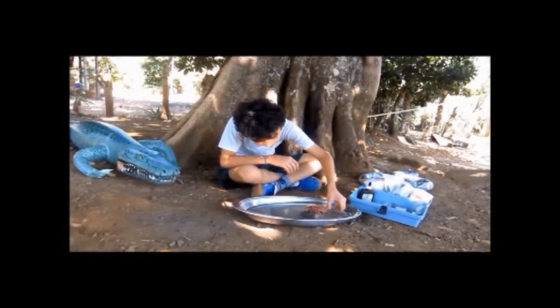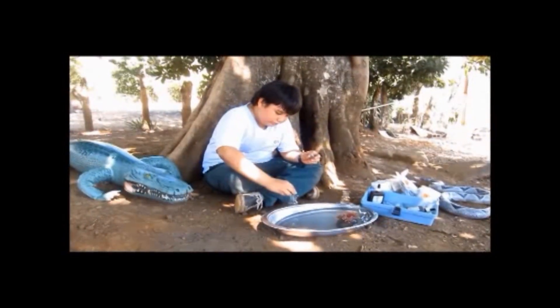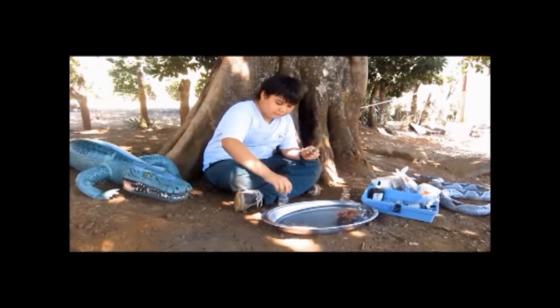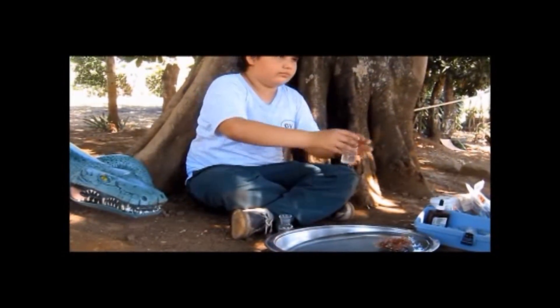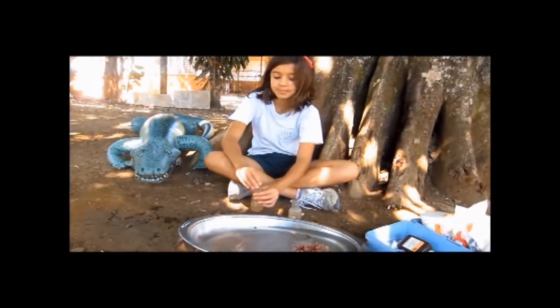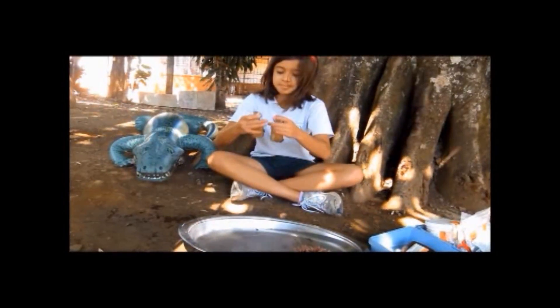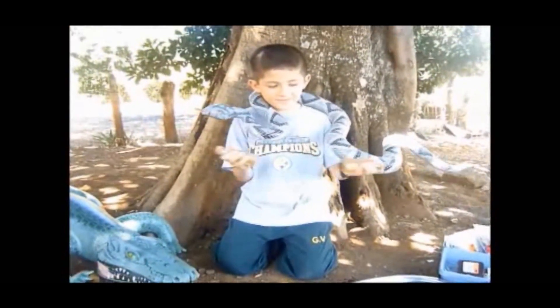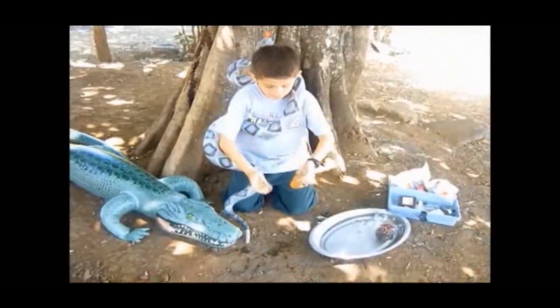Get sample water A and B. Add oxygen reagent 1 and oxygen reagent 2 to each sample. Grab the bottles and stoppers firmly and shake to mix. Wait until the floc is halfway.